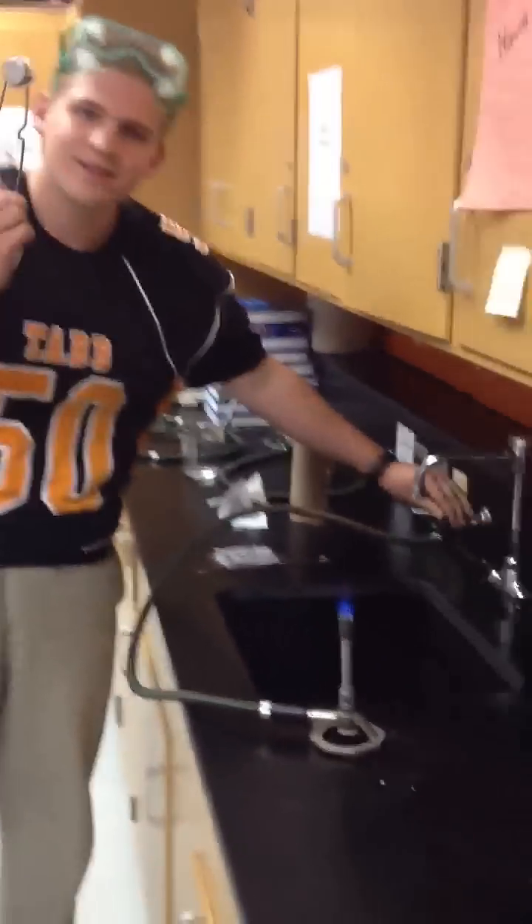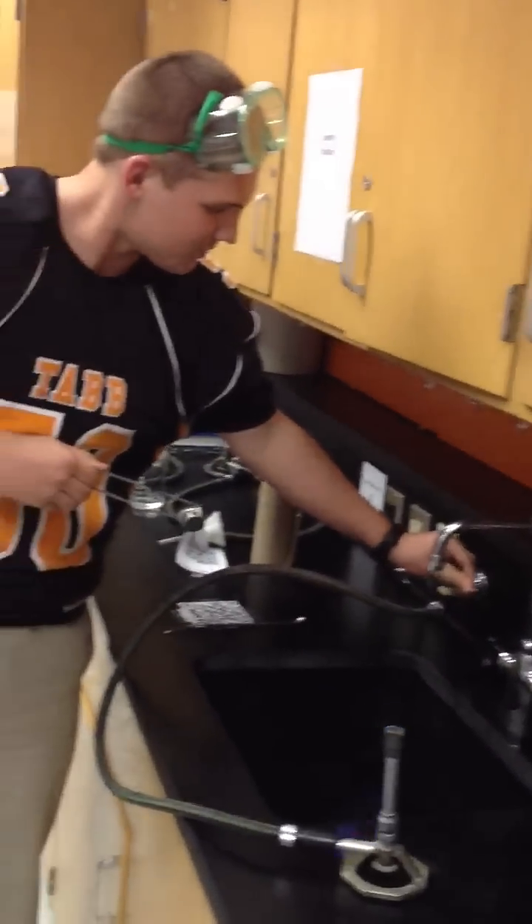And basically how you do it. There you go, Zach. And also, remember to turn off the gas when you're done. Right there — towards the wall, flame goes out. And there you have it.